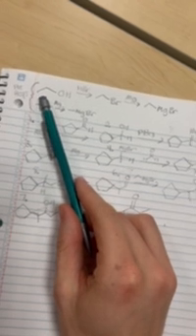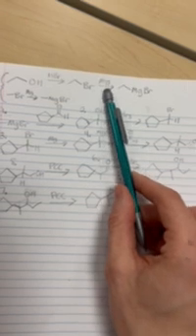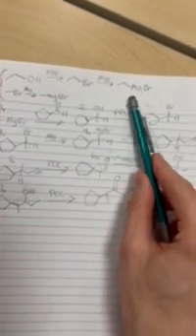So we were given certain compounds that aren't necessarily useful just as they are, so we had to make something out of them. So for our prereqs, we took our alcohol here, and we reacted with HBr. This is an alkyl halide formation, or in our case, we did an alkyl bromide. We formed an alkyl bromide. And then we reacted that with Mg, magnesium, to then form a Grignard reagent, which we have here.